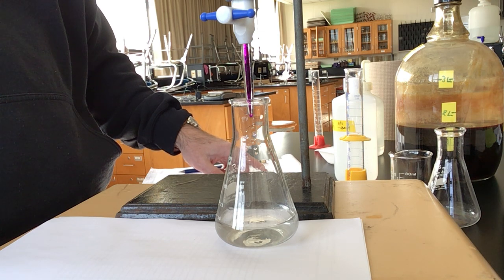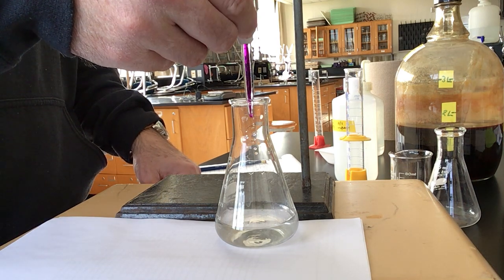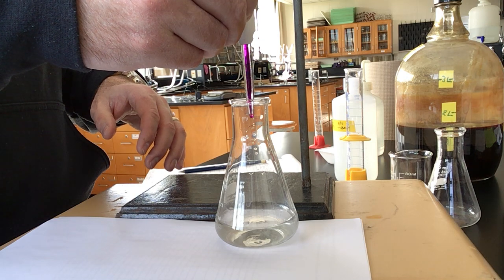And we're going to titrate to the endpoint again, looking for that faint pink color that remains in there for about 30 seconds or so.